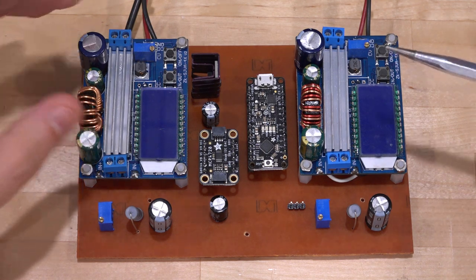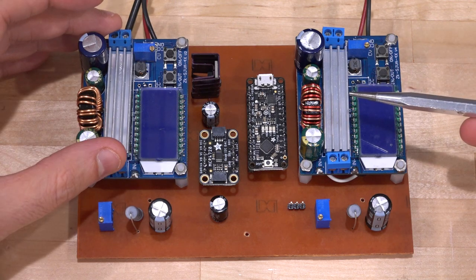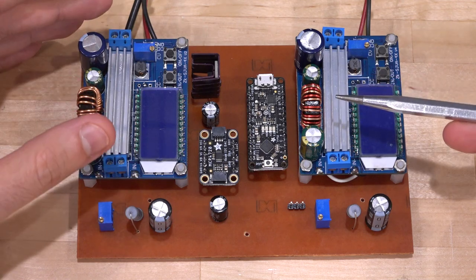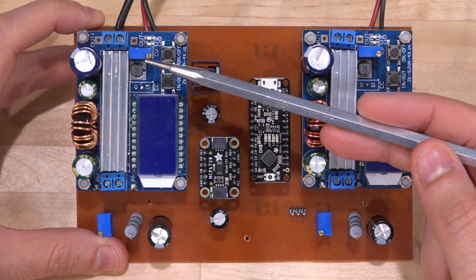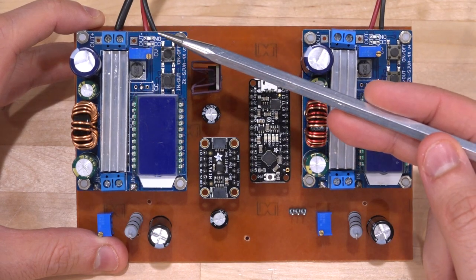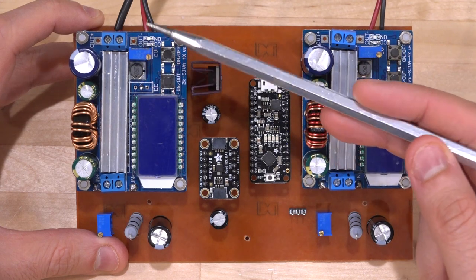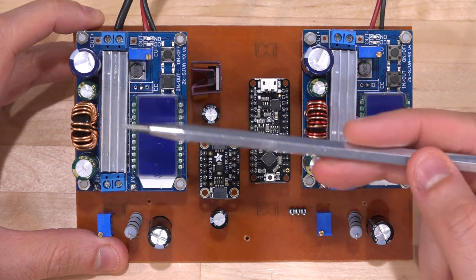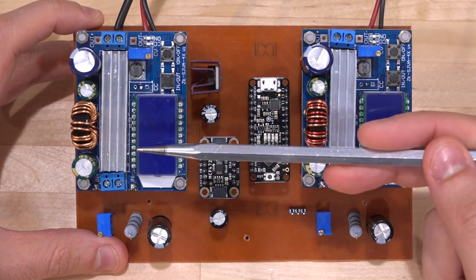So what we have on this are two buck boost converter power supplies. These are pretty inexpensive. You can buy them for just a few dollars. And what they do is that they are able to drive anything in either a constant current or a constant voltage configuration. They typically come with two potentiometers. One potentiometer controls the output voltage, and the other potentiometer sets the output current limit. So if the current being taken from this is above the amount that it is programmed to deliver, it will run into a constant current, just like a regular power supply would. So these are perfect for driving those LEDs.